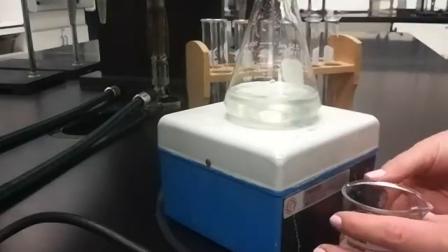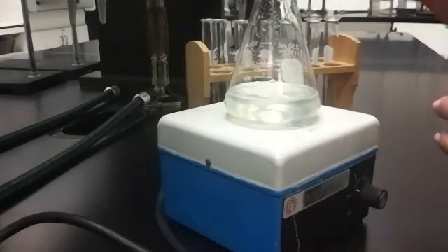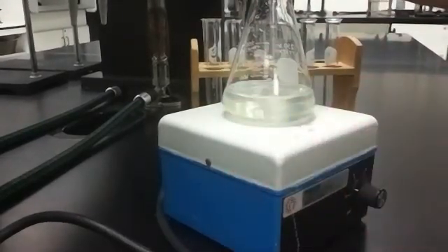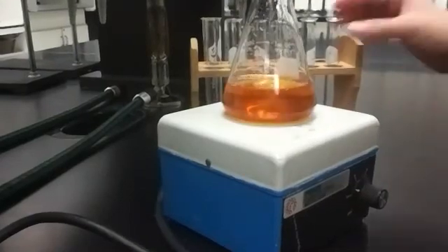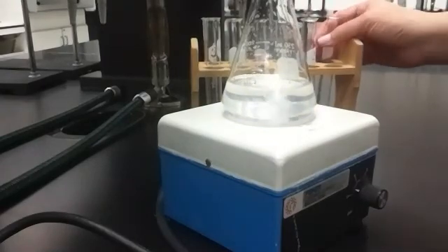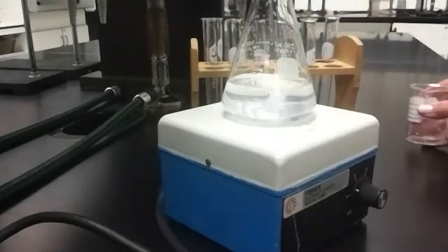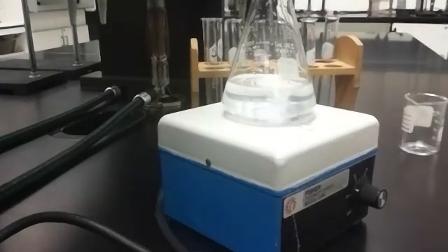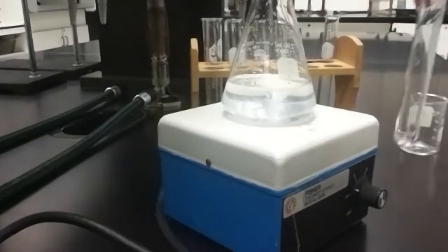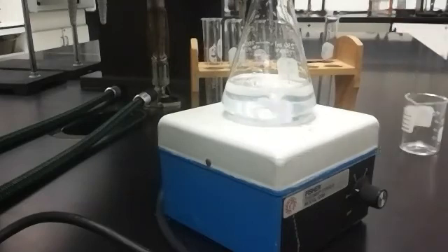Okay, so here we go. Reaction's about to start. I'm going to mix everything together. I've got my stir rod going. I would mix this in. Okay, we get a color change. I'm going to add one of these. Colors should go away. I start my timer. Now I'm going to keep my timer going until I see another color change. When I see another color change, I'm going to add one of these test tubes to it.